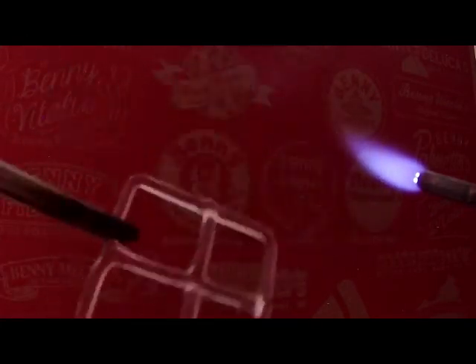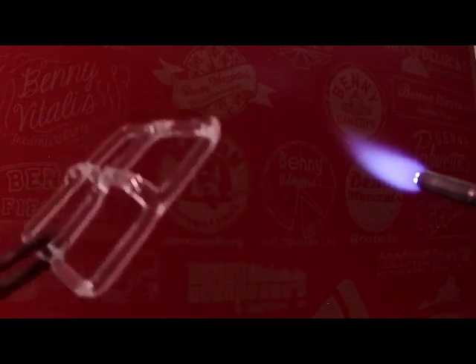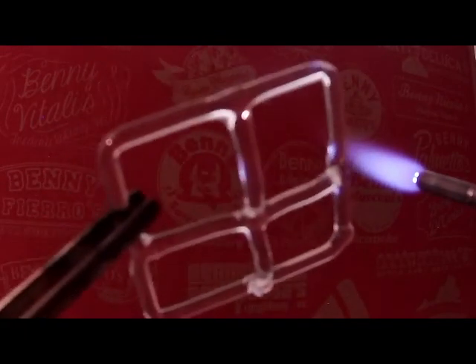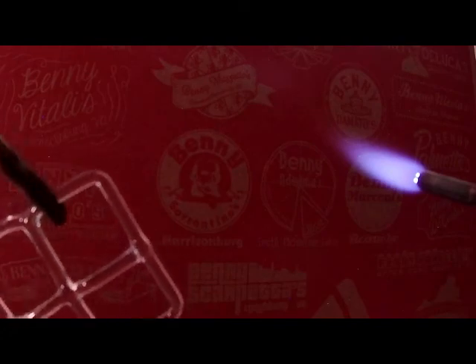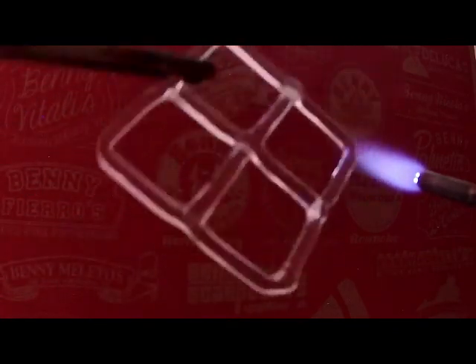But the setup is pretty compact, relatively cheap compared to certain of the other bench burners. You can also do this with a small bench burner, by the way. But the nice thing with the mini torch is just how compact everything is as far as the gas cylinders that need to feed it. Because obviously, the bigger the torch is, the more fuel and oxygen it's going to go through. So again, that's why I like using this micro torch for this particular exercise. So there we go.